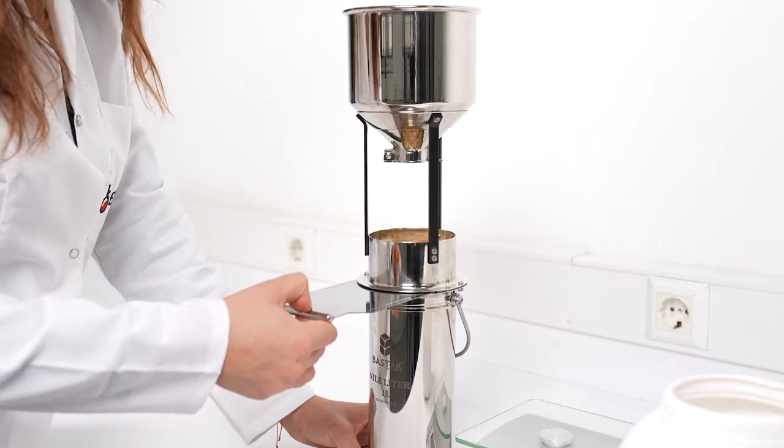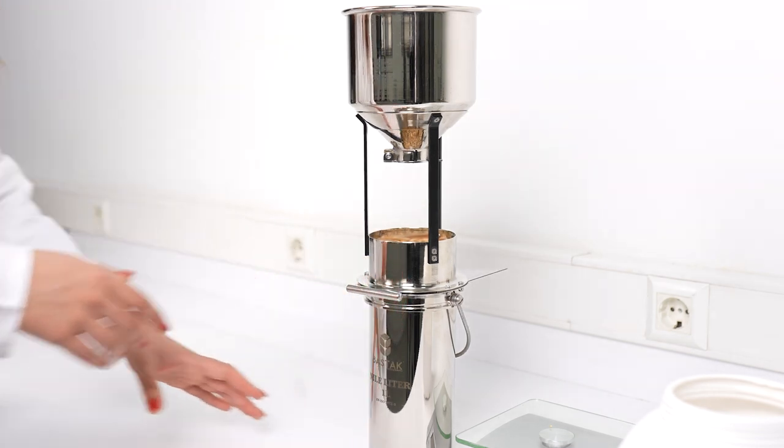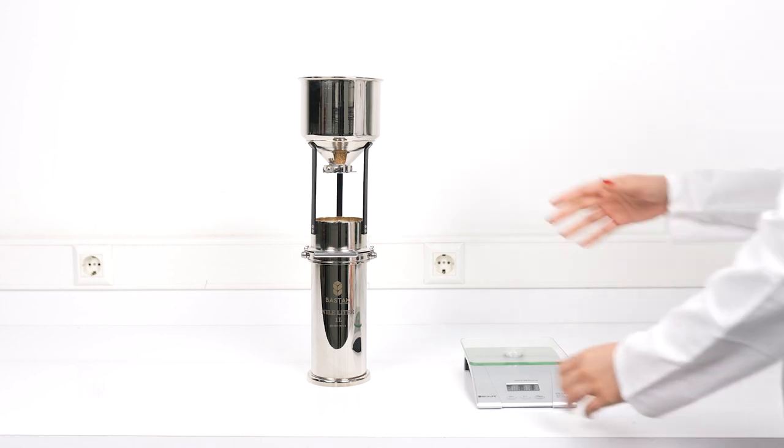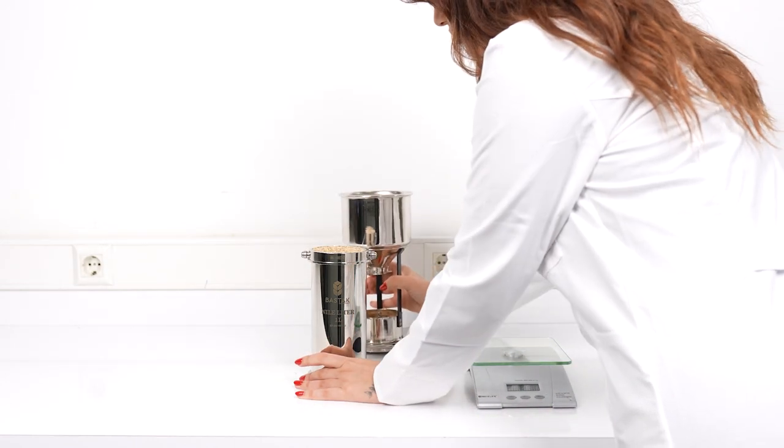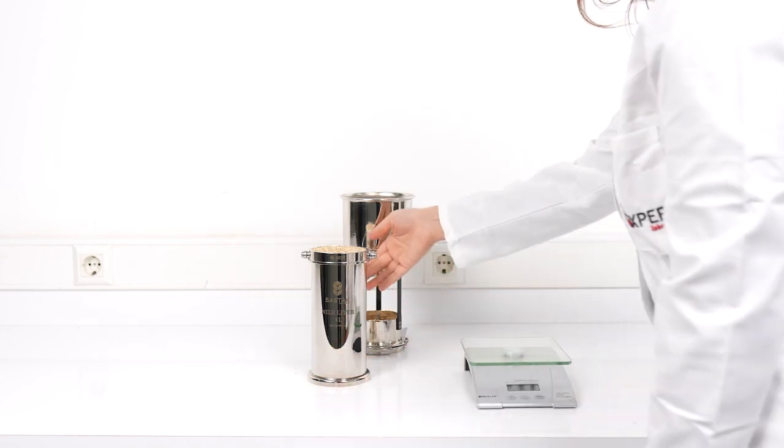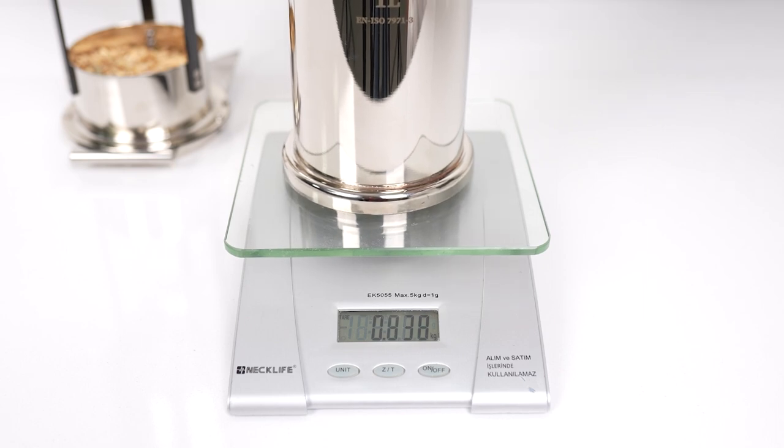Since the mouth of the knife is sharp, avoid placing your hand on the opposite side or the exit point during placement as the knife could cut your hand. Once the cutting process is complete, the filling container and excess sample are removed from the measurement container. Subsequently, the measurement container and the sample are weighed on the scale previously tared for the measurement container.